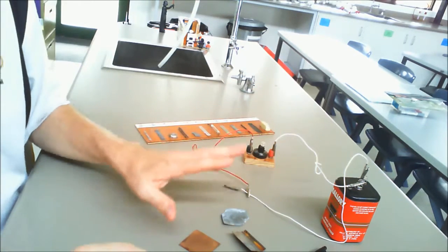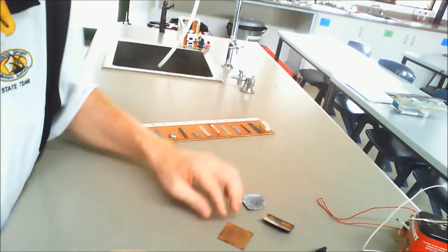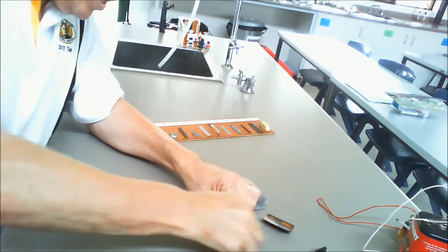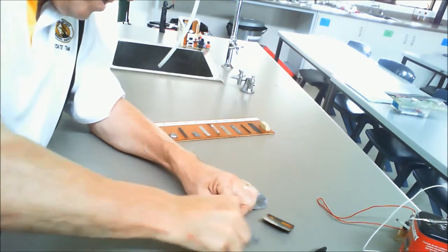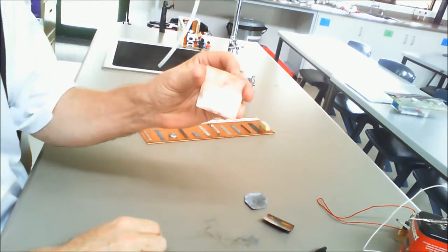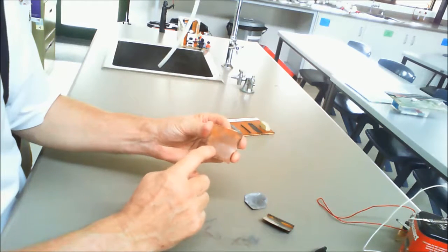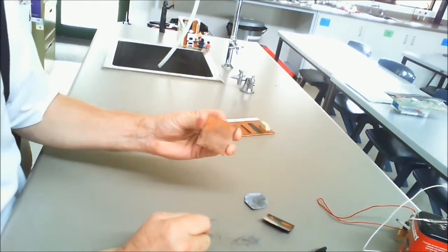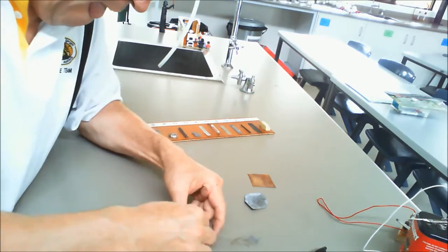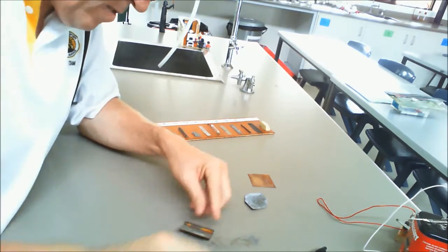Now these metals react with oxygen in the air to form a coating. So what we need to do is give it a wipe off with some steel wool. So you can see underneath there that it is in fact relatively shiny. Shiny down here as the light reflects off it, and dull where I haven't got anything off. It's the same with the tin.